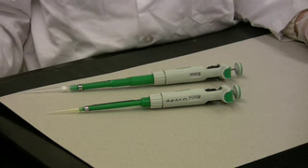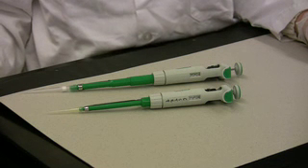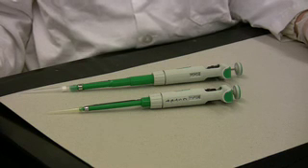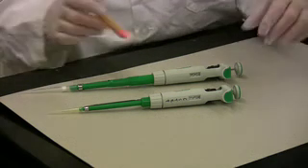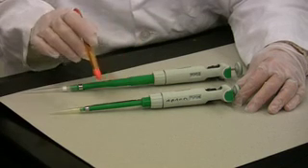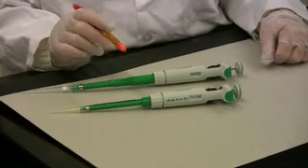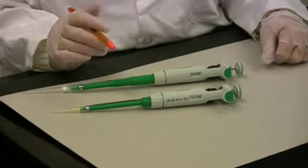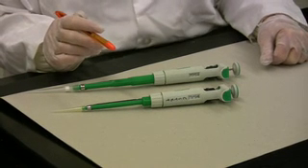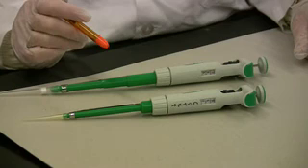Micropipetters are an essential piece of equipment for any molecular biology and cell biology laboratory. These micropipetters are used to transfer small amounts of liquid, ranging anywhere from about 0.5 microliters to 1,000 microliters, or 1 ml.